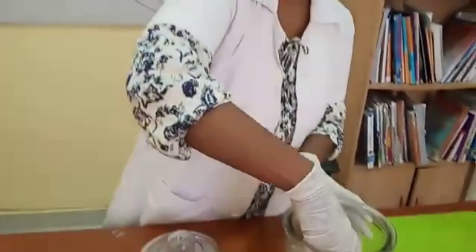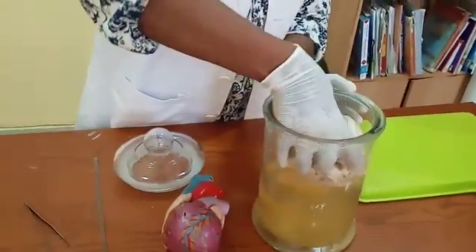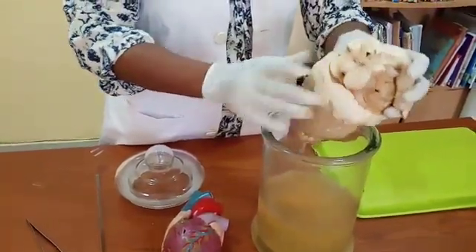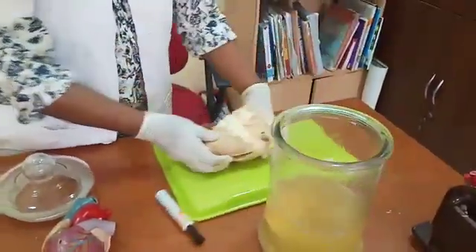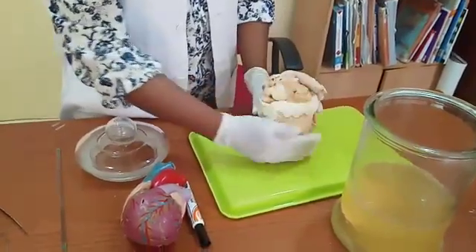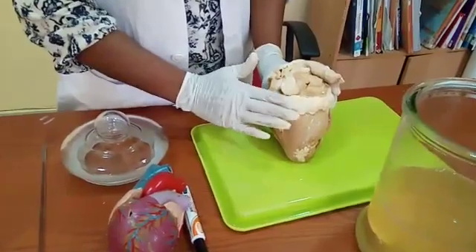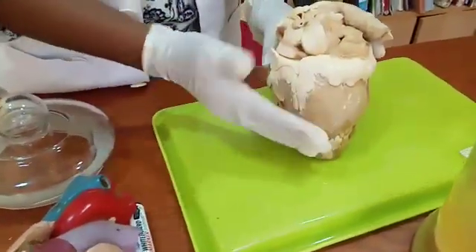This is the real heart of a cow. I am going to show you the real heart of a cow. You can see the structure — it is bigger than the human heart.